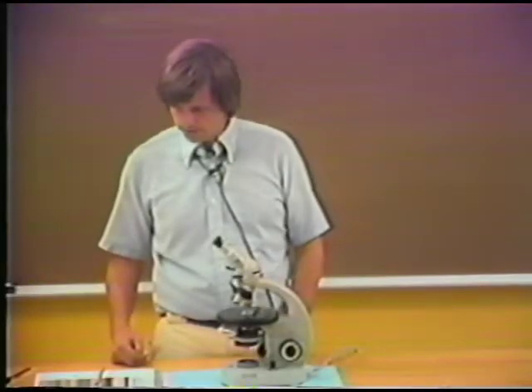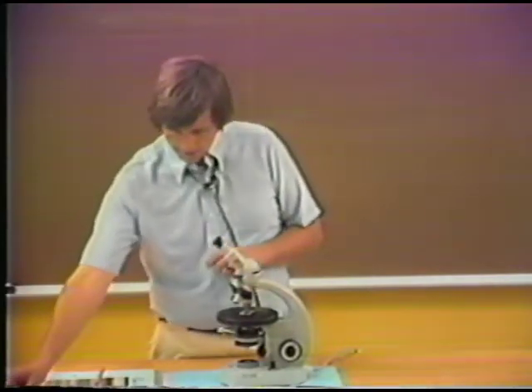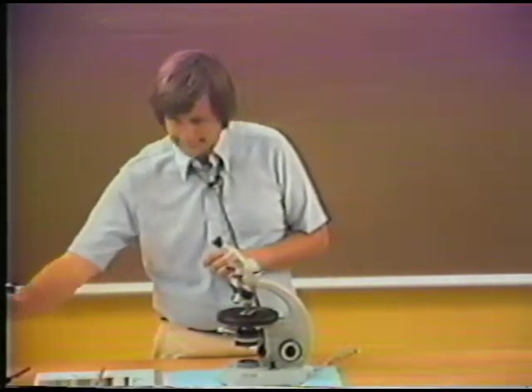These very high order interference colors are indicative of a very large retardation and a very high birefringence. The birefringence of calcite is greater than 0.1, and this is an example then of extremely high birefringence. So we've used the interference color as observed in thin section as an estimate of the birefringence of particular mineral grains. Now the next property I want to talk about is extinction.